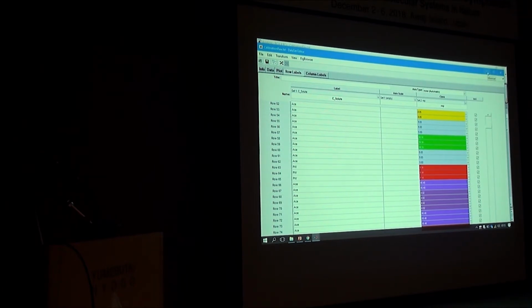So when you see these pictures, you believe in aquaphotomics. There is information there because those patterns are telling the story. Also, for example, you have 5 consecutives, I think in this data, of each of the samples. And we want these consecutive spectra to bring information about the sample itself. So if we want to use these 5 consecutives as information for the sample, what should we do? That's why we give them the same color.